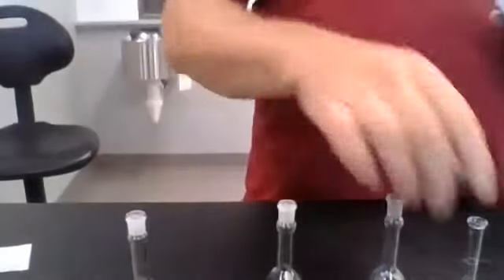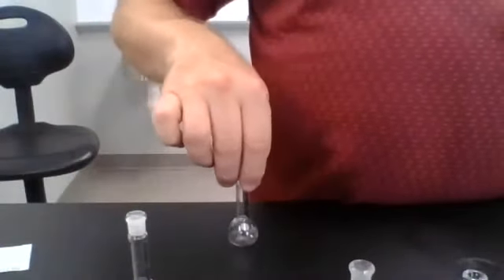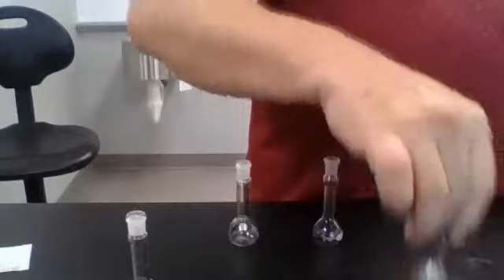Now, how am I going to get 1 milliliter in here precisely? I'm going to use my handy dandy pipette. I'm not going to worry about doing it super well. I'm going to try to give you data like a normal freshman class would get. Some of you do a lot better than I do. I'm going to try to get this to where you can see these. Hopefully, I won't actually put it onto my computer. I guess I need to put them further away to see them.